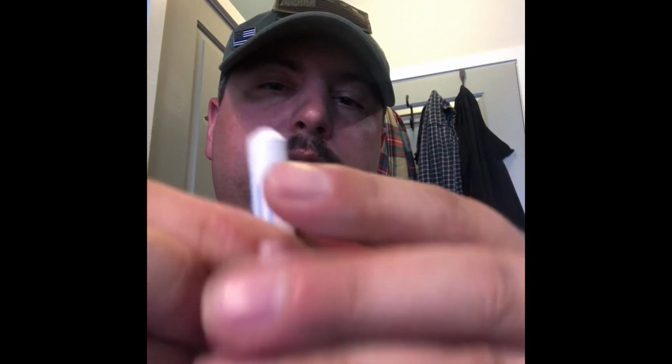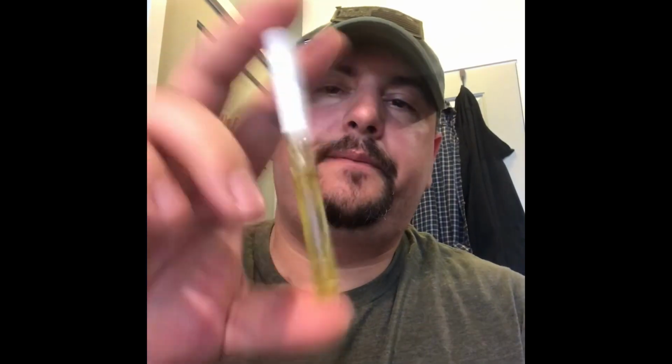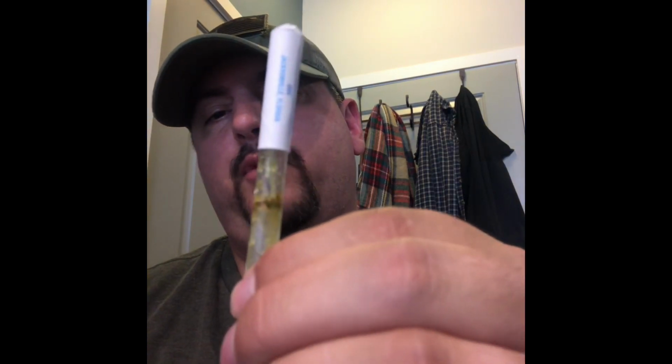Is this going to turn a color? It didn't the first time with nothing in it. So let's see. A little harder to break. That liquid is mixing with the substance. Shake it up a little bit. Break that second ampule. Yeah, no. Nope. It just turned cloudy and gross looking.